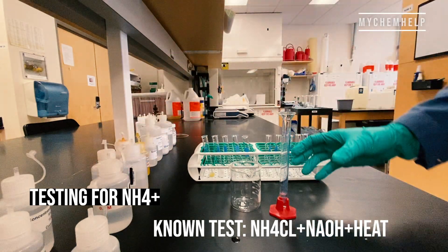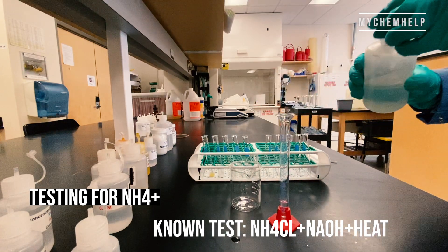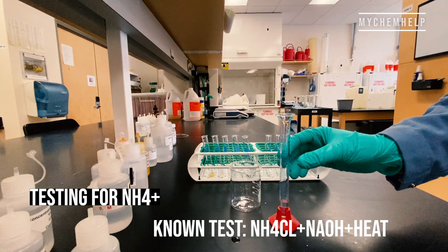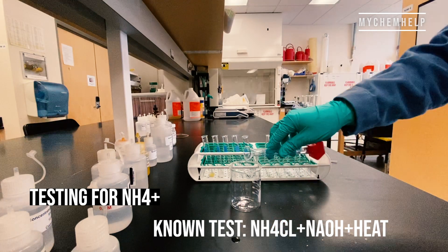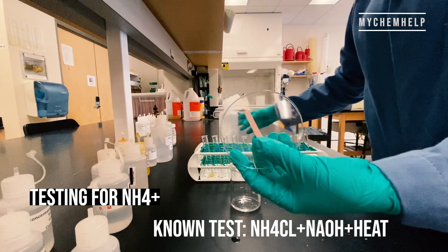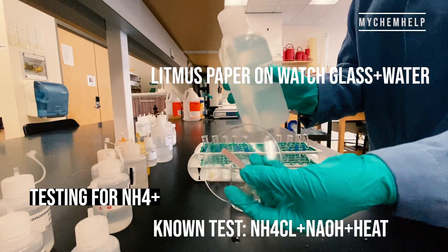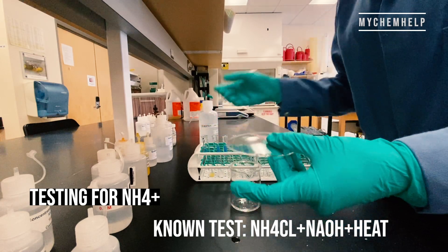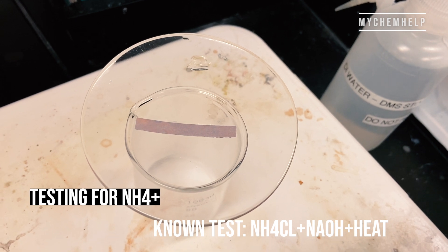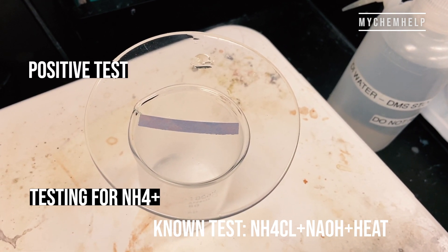Next we're going to test for an ammonium ion. That's two milliliters of ammonium chloride followed by two milliliters of sodium hydroxide, going right into the beaker. I've got litmus paper on a watch glass — I'm adhering it to the surface with a bit of water and sticking it on top of that beaker. We're gently heating it to see if the vapors turn the litmus paper blue, and we've got a positive test there.